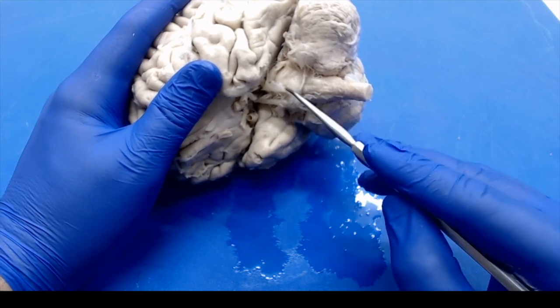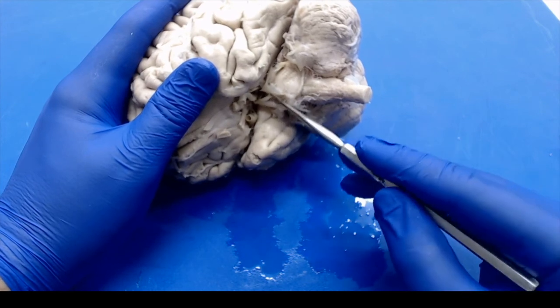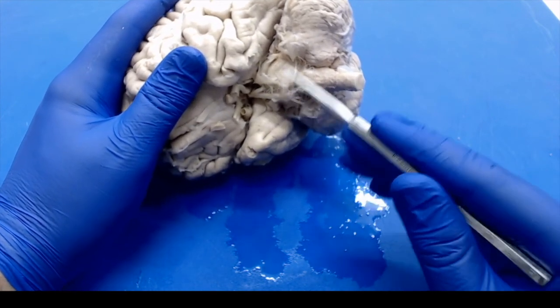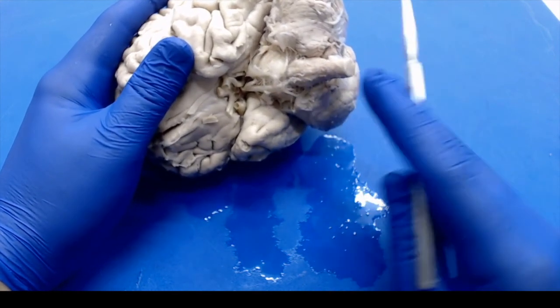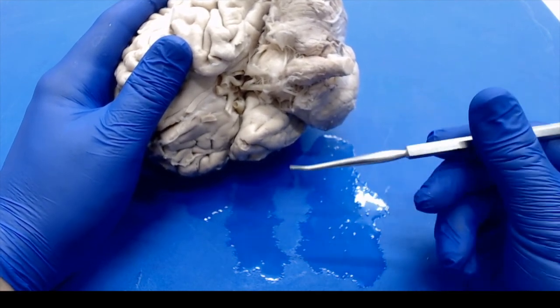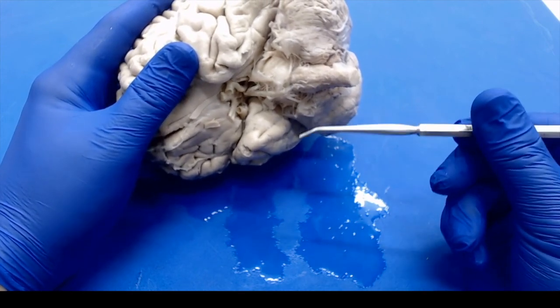On this brain, you can see some of the circle of Willis. We'll go over that in more detail shortly on a better specimen. We don't have all of our cranial nerves attached, but you should remember those from anatomy. They don't play as significant a role in autopsy dissection, but they'll be important for studying for your certification exam, so make sure you're at least aware of where those are.